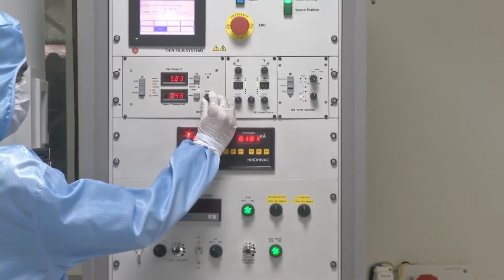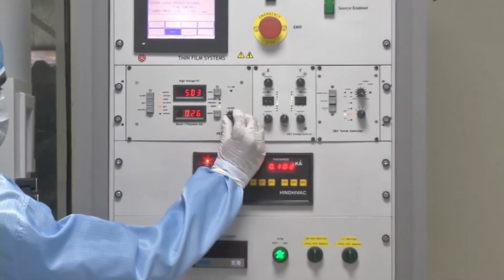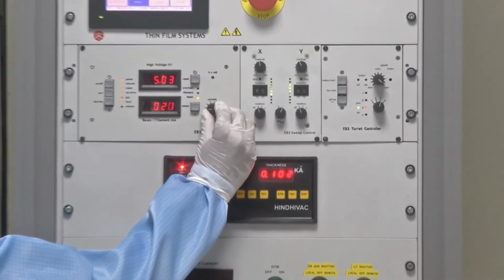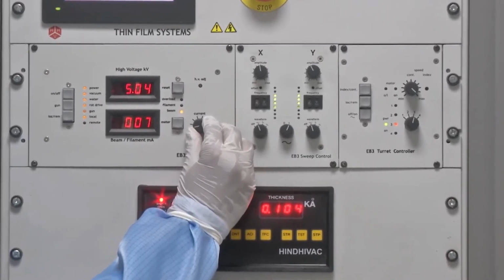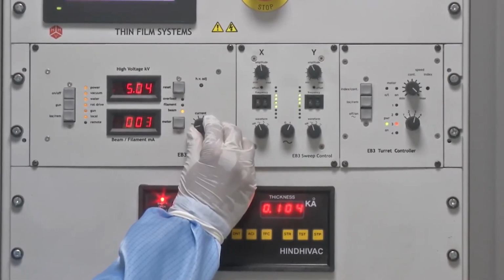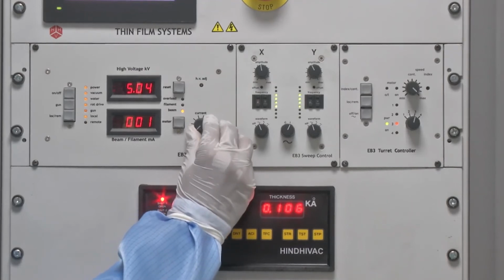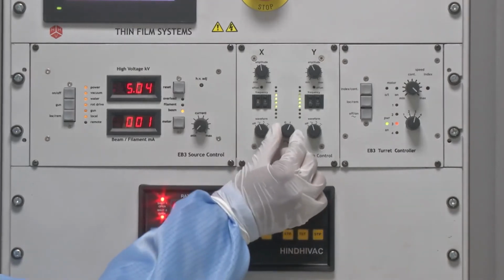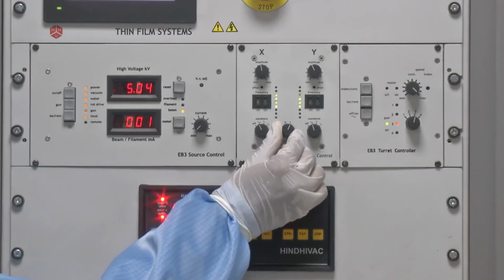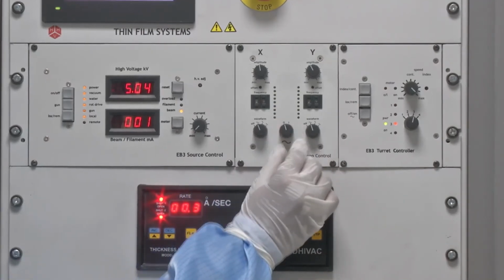Now one would question why we need to turn off the shutter. The reason is, if we don't turn off the shutter, the current is going to be decreased, and if we keep on decreasing the current, the rate of deposition will gradually come to almost zero, which will lead to formation of puddles or spots on the substrate, and whatever deposited material will be there, the quality of that material will be lost. After we bring the current down to zero, the next step is to reduce the amplitude knob to zero position.